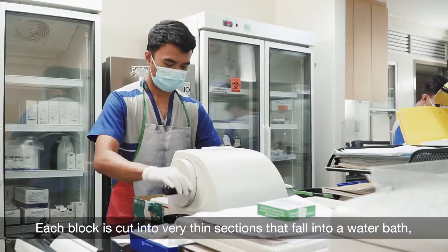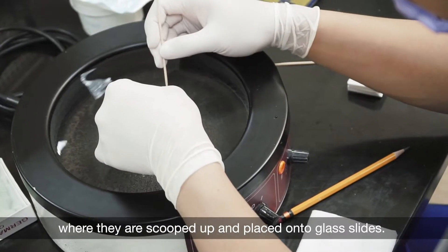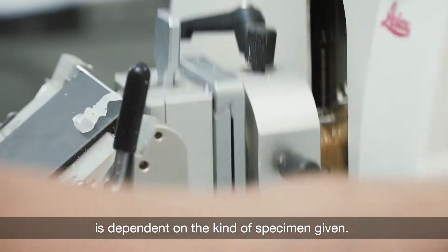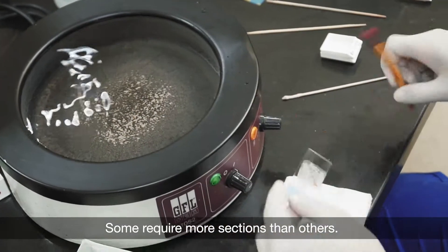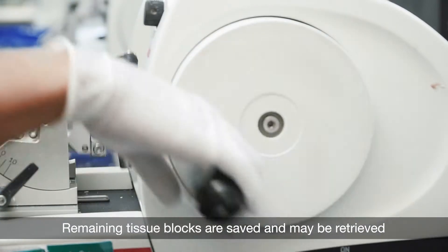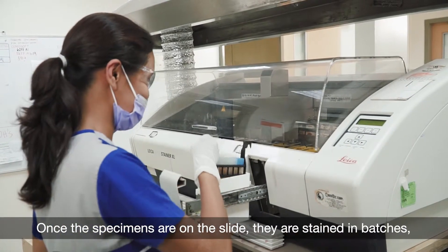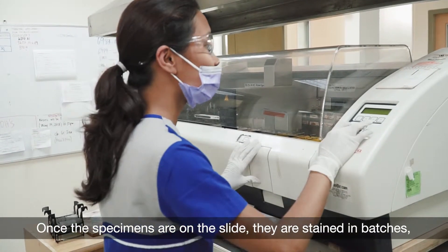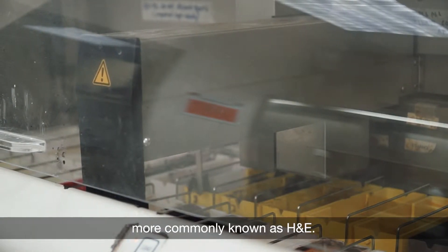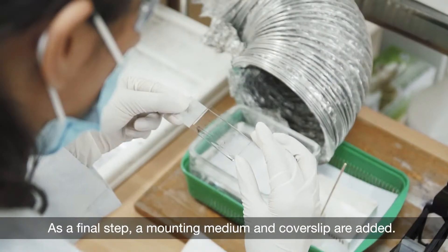Each block is cut into very thin sections that fall into a water bath, where they are scooped up and placed onto glass slides. The number of sections evaluated per specimen is dependent on the kind of specimen given; some require more sections than others. Remaining tissue blocks are saved and may be retrieved for review and further tests even years later. Once the specimens are on the slide, they are stained in batches using two chemicals, hematoxylin and eosin, more commonly known as H&E. As a final step, a mounting medium and cover slip are added.